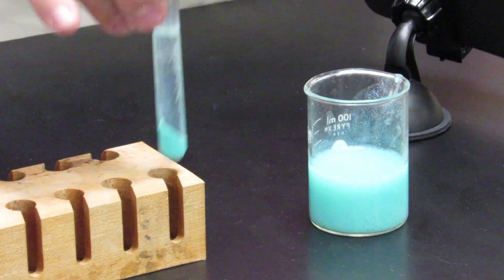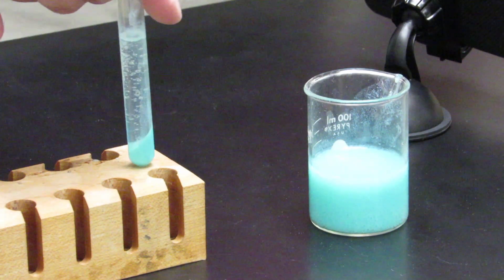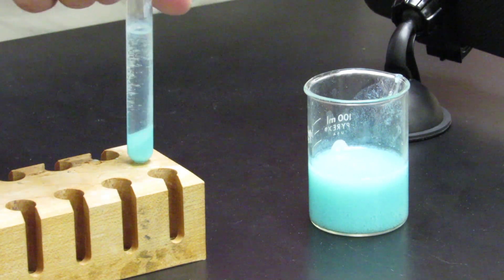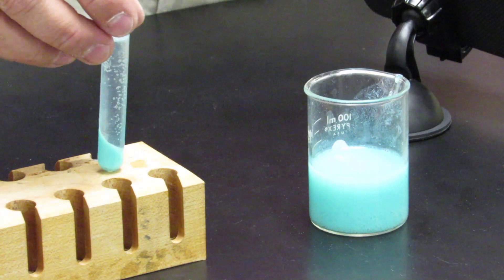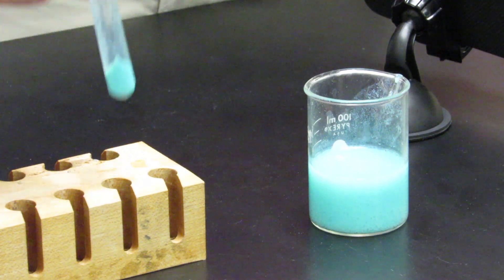We now have a nice separated suspension. The clear liquid is on top, and the precipitate has settled to the bottom of the test tube. This is evidence of a chemical reaction, which is indicated by the formation of a precipitate.